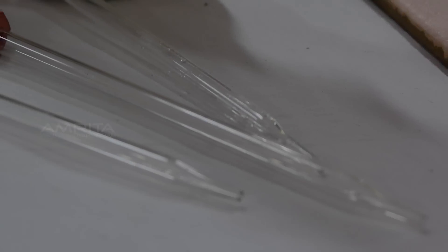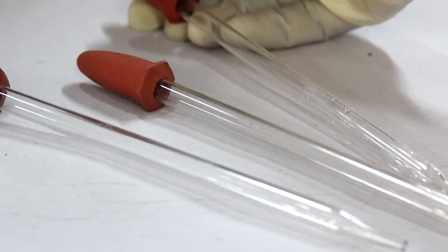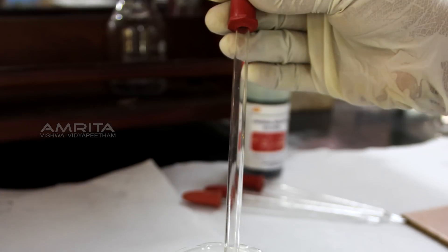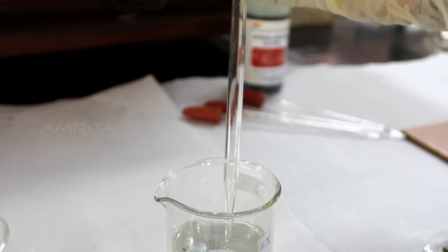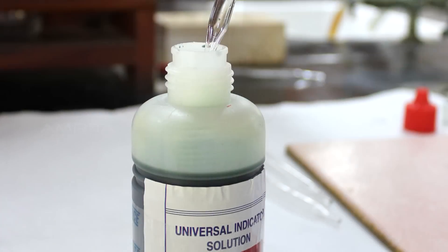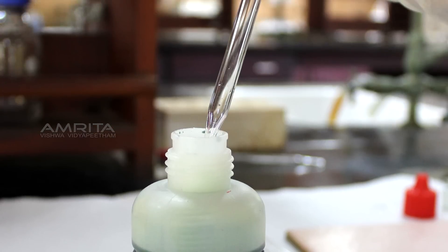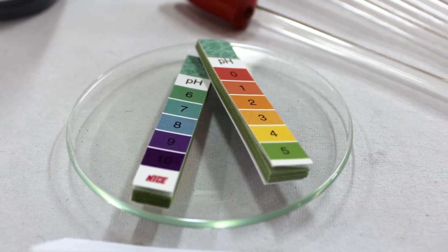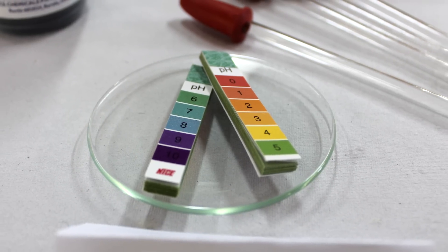If you are using the same dropper for the test of all samples, ensure that it has been properly washed with water after every test. Make sure that the pH strips are kept away from chemical fumes.